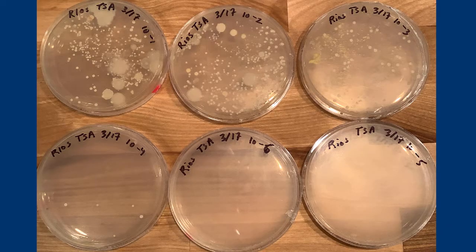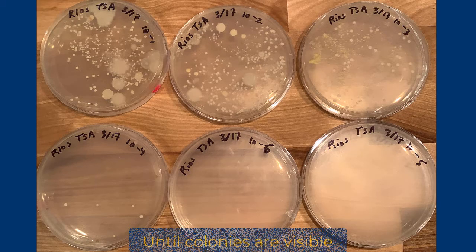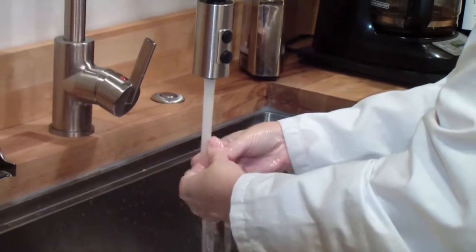Store your plates agar side up, clean your workspace, throw away the tips, the spreader, and the empty Eppendorf tubes. Disinfect your workspace and wash your hands.